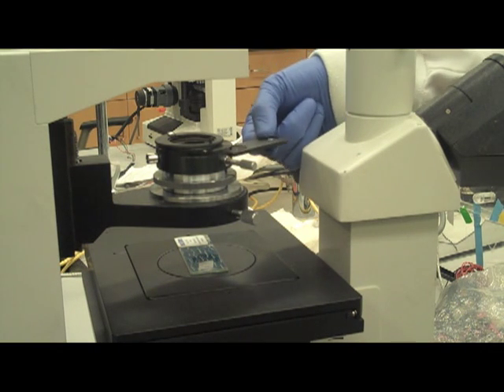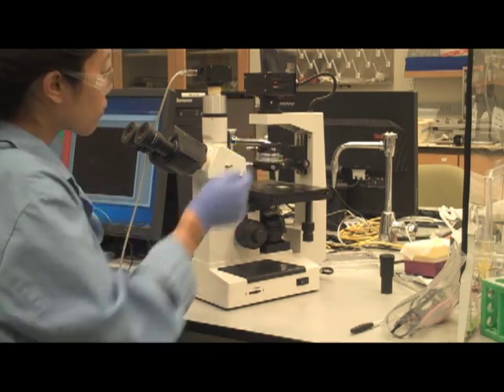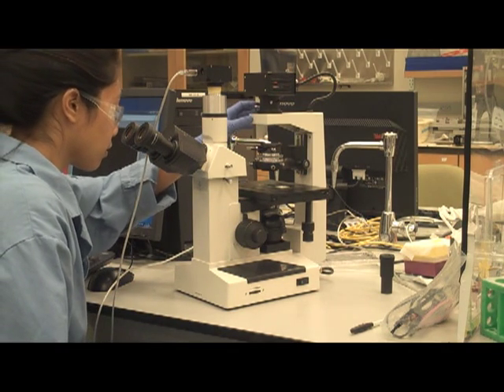Insert this piece into the annular diaphragm slot and make sure to turn the aperture dial to maximum aperture by rotating it counterclockwise.